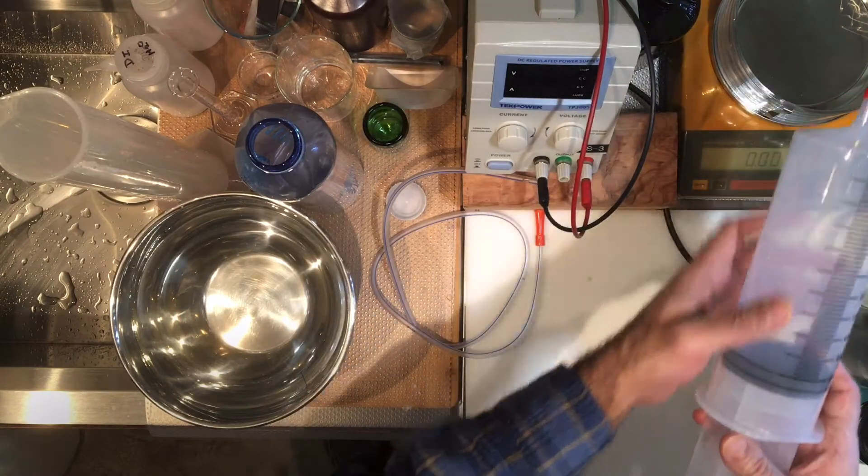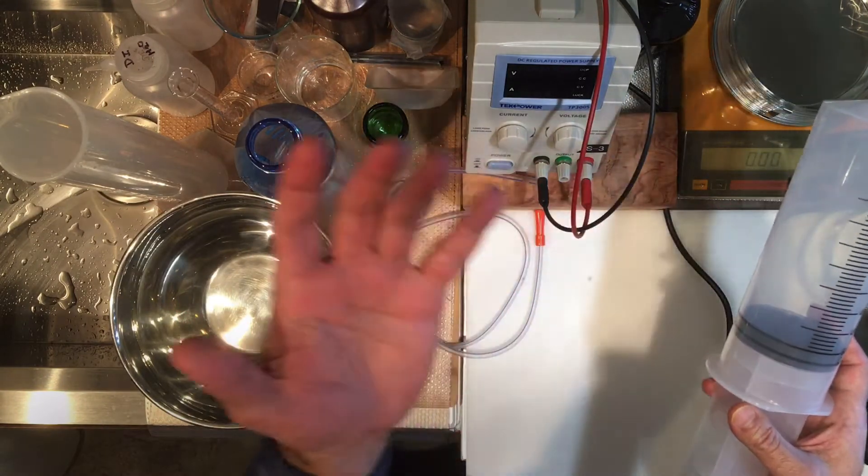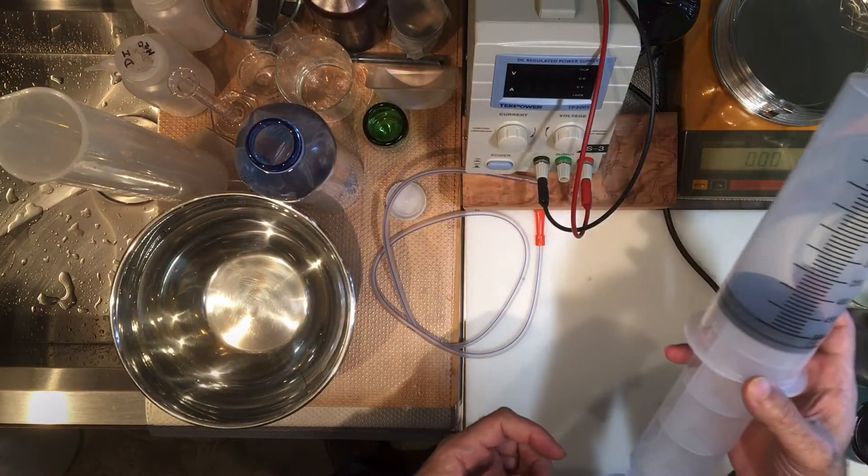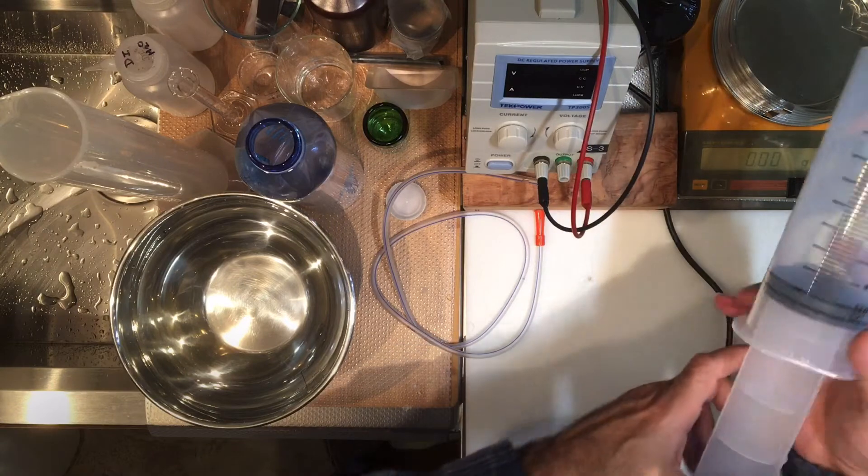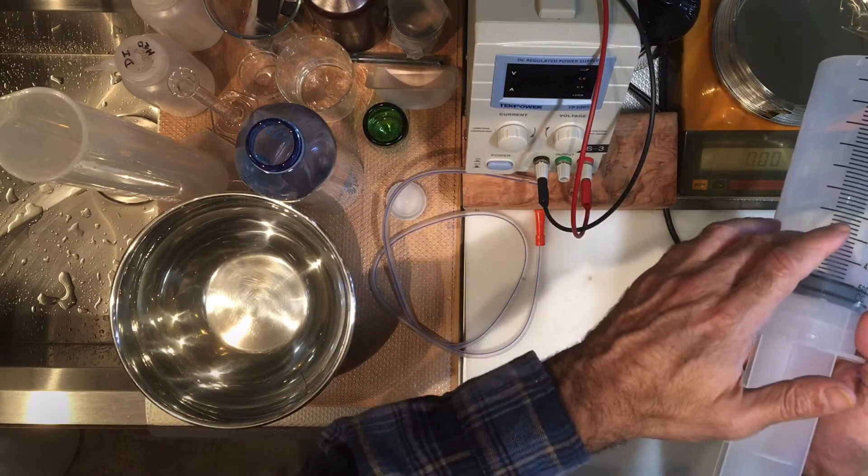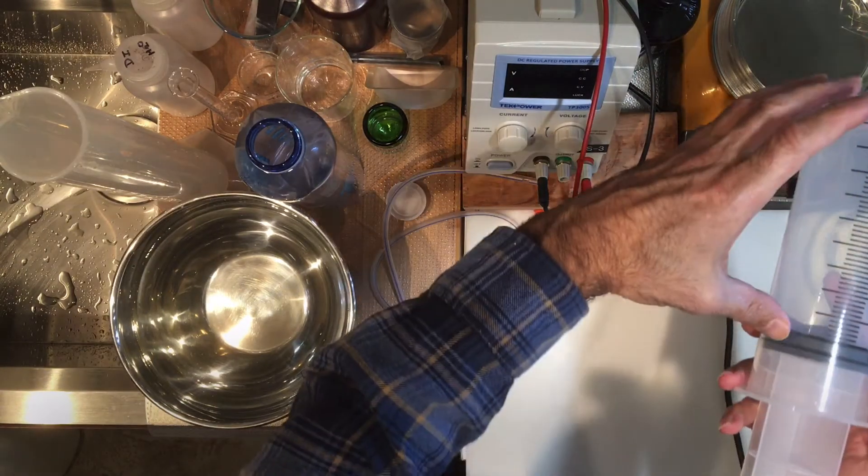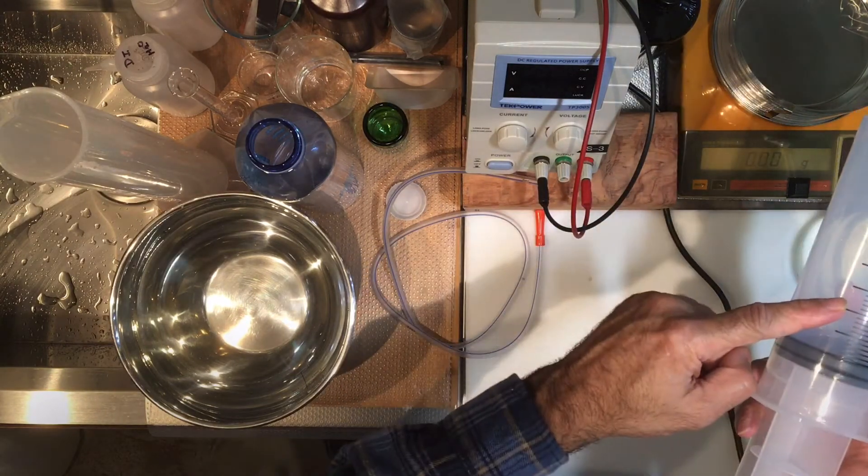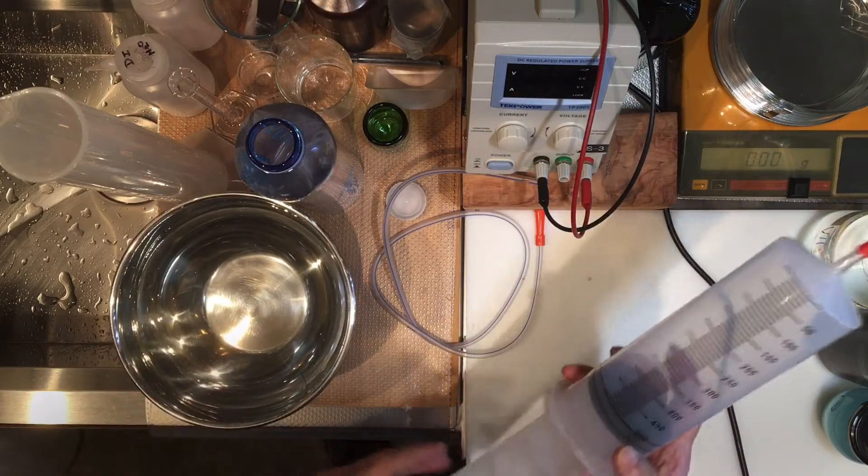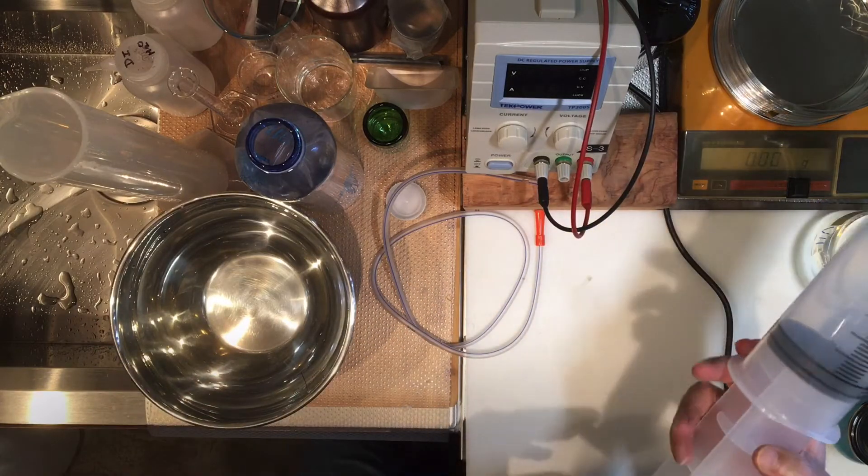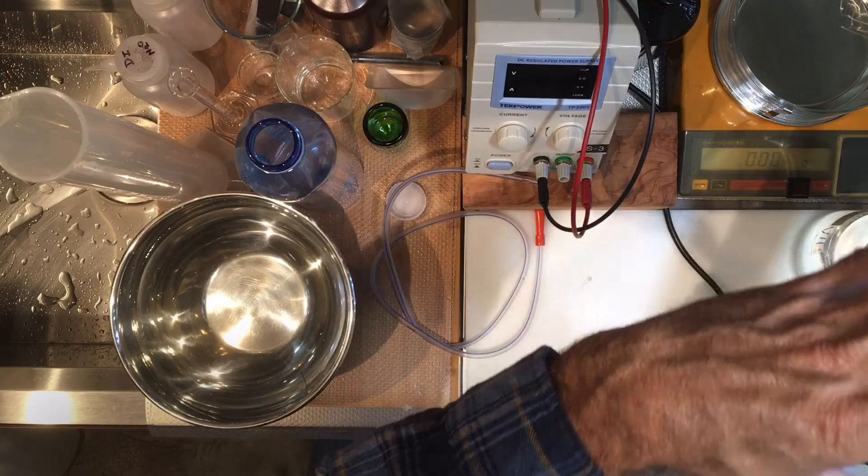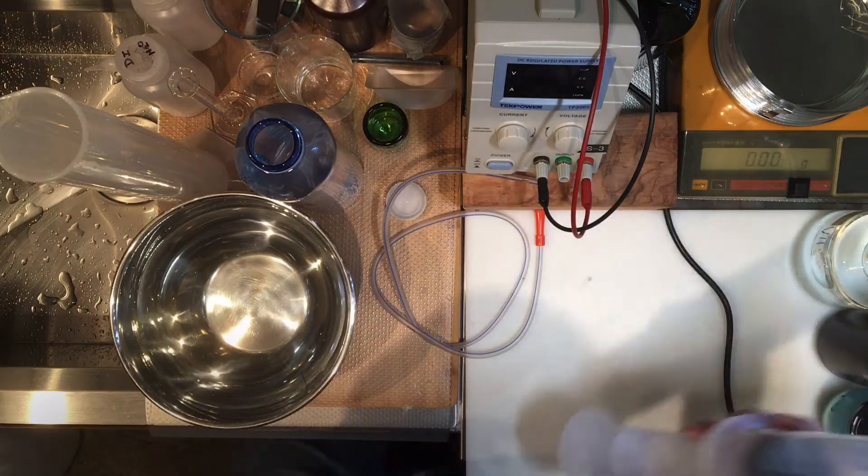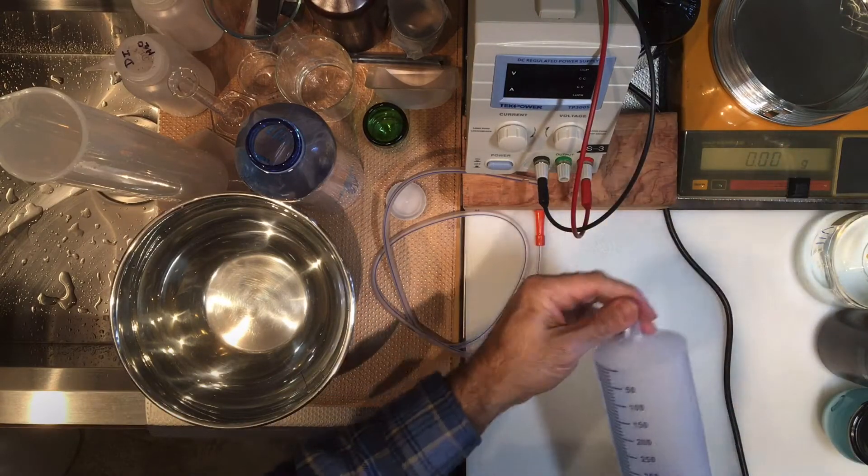I want to know how much air is inside so I can subtract it out. If I put a new gas in, this gas could be an unknown gas or say carbon dioxide which I'm going to measure. You can now reweigh the syringe and have the mass of syringe and the gas, subtract it from the mass of the truly empty syringe to get the mass of the gas. There's air trapped inside, I want to subtract and find how much air is inside. We'll subtract the mass out.